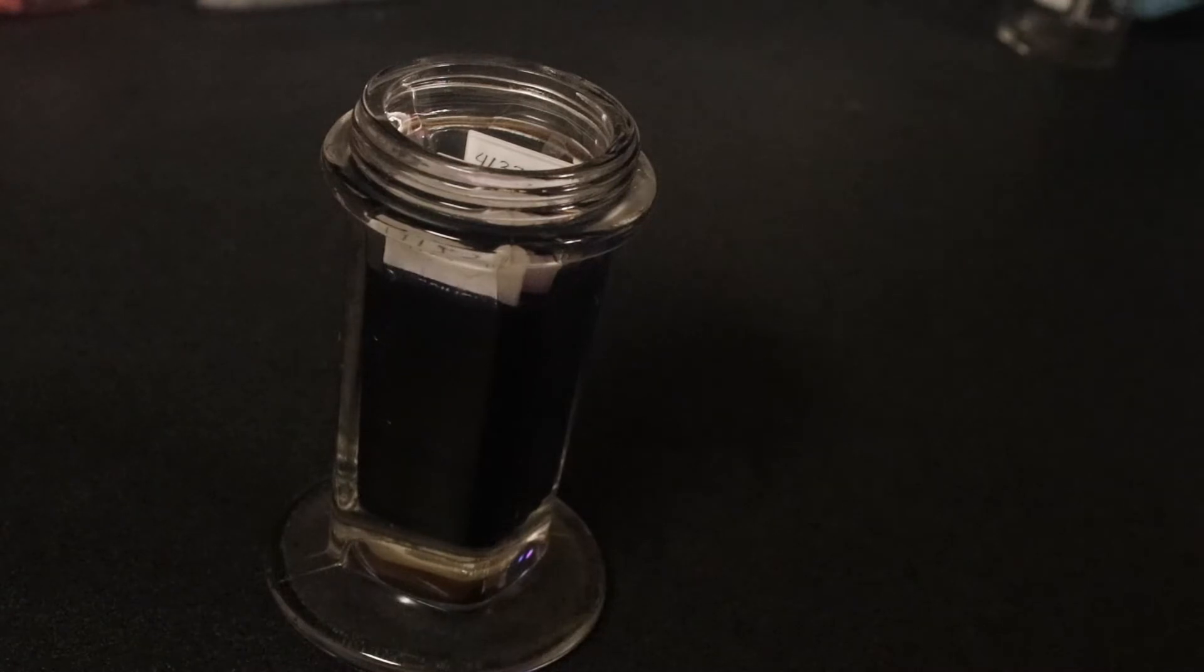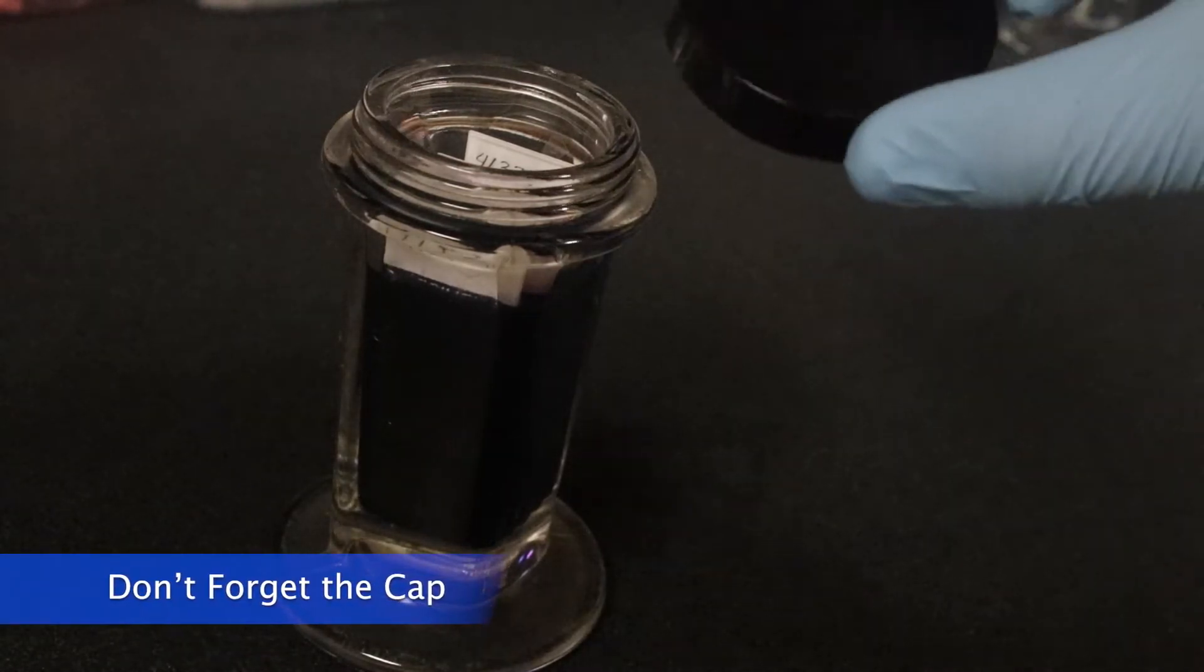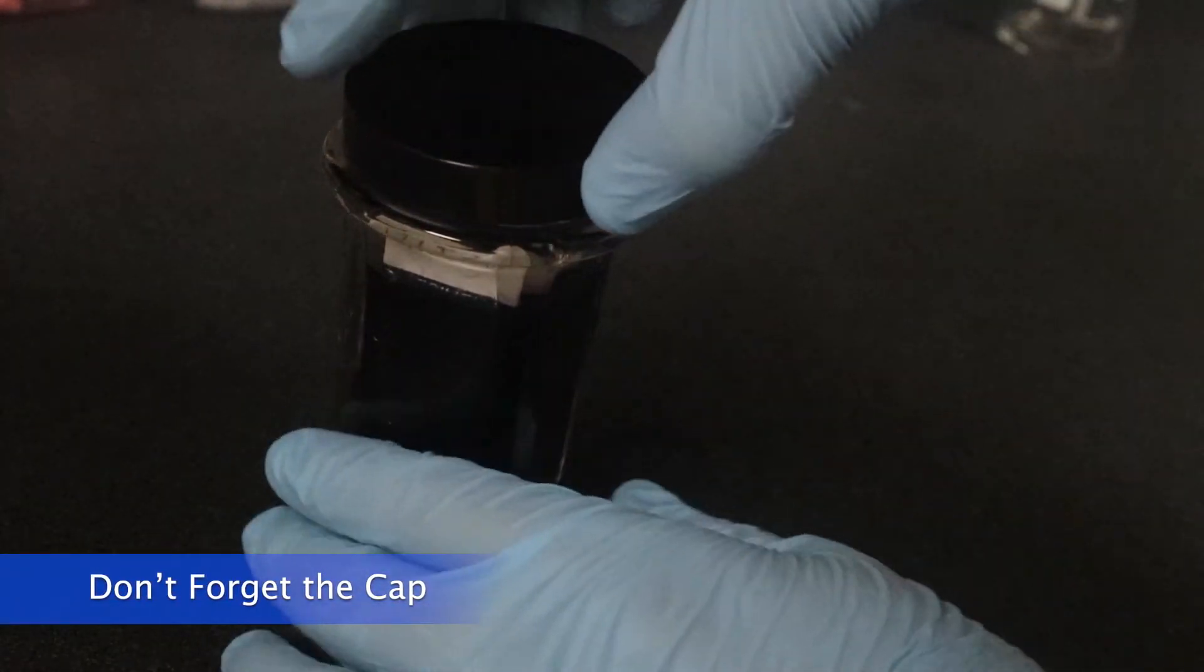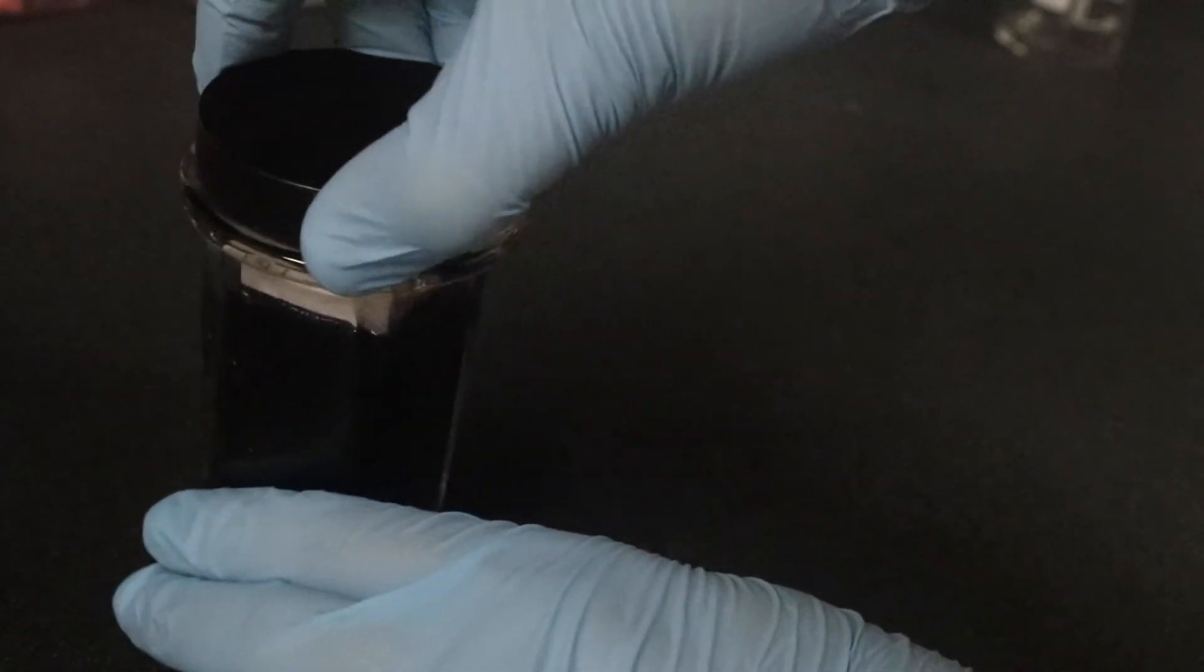Of course, don't forget to put on the cap while it sits because it's dangerous to leave out a chemical while it's unattended.